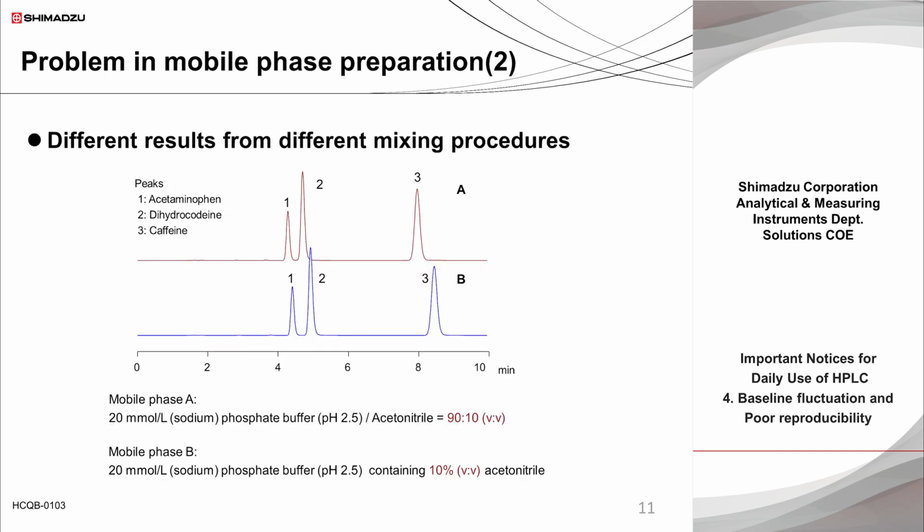This slide compares the chromatograms obtained by preparing the mobile phase with phosphate buffer and acetonitrile according to the notation on the previous slide. In the upper case, the mobile phase composition is defined by the volume ratio before mixing, and the mobile phase mixed with 900 milliliters of buffer and 100 milliliters of acetonitrile contains 100 milliliters of acetonitrile in a total volume of slightly less than 1 liter. The mobile phase in the lower case contains 100 milliliters of acetonitrile in an exact volume of 1 liter. Therefore, the upper case has a slightly higher ratio of acetonitrile in the mobile phase, resulting in faster elution of the compounds in reversed phase mode. Since the organic solvent ratio in reversed phase mode has a significant effect on retention time, it is important to prepare the mobile phase correctly as specified.